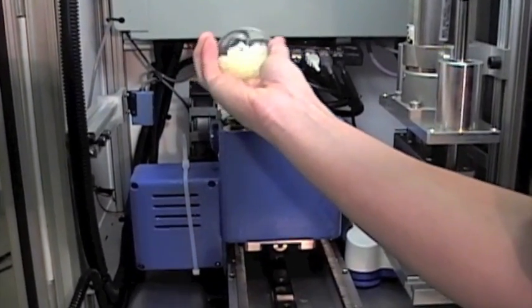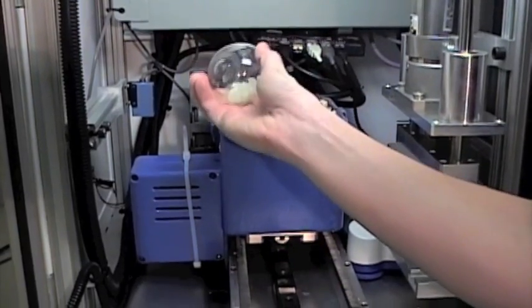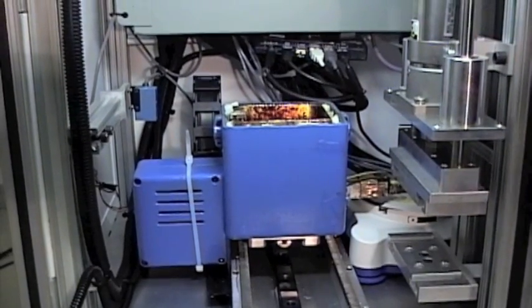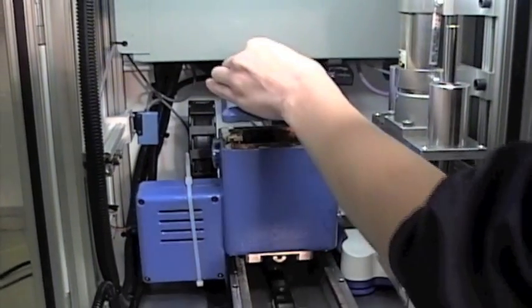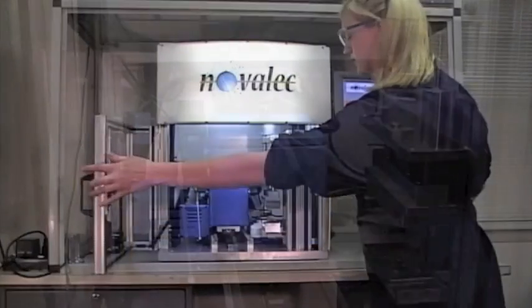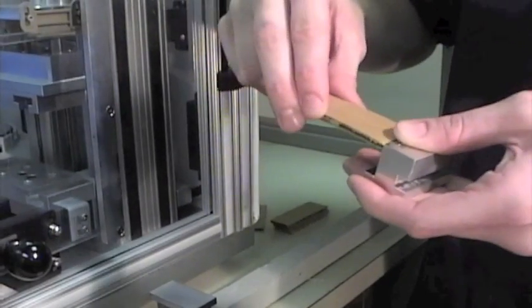To begin testing, fill the glue tank with hot melt glue and allow the glue time to heat up. After the glue reaches the specified temperature, remove the aluminum sample holding blocks and secure sample pieces of cardboard onto both blocks.